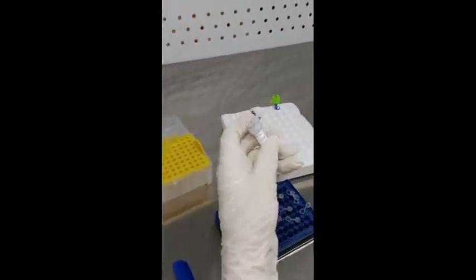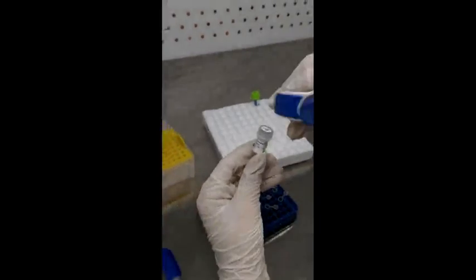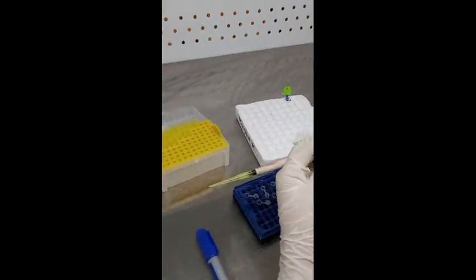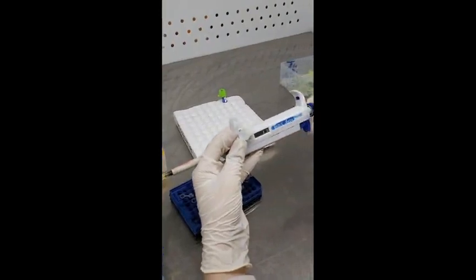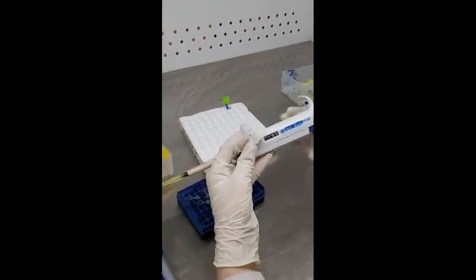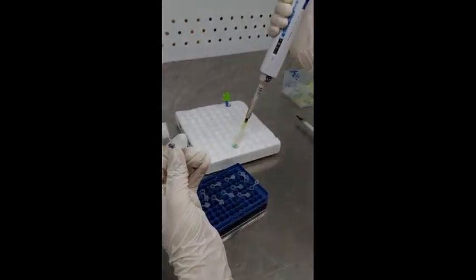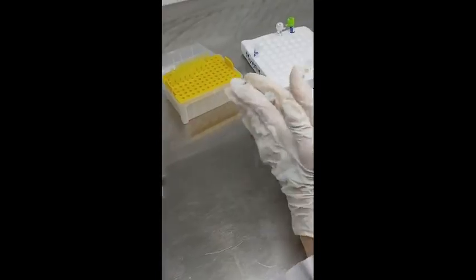The next thing you have to do is add the nuclease-free water. For one reaction we need 9.5 microliters of nuclease-free water, so for 11 reactions we are adding 104.5 microliters to the tube that already contains the master mix.